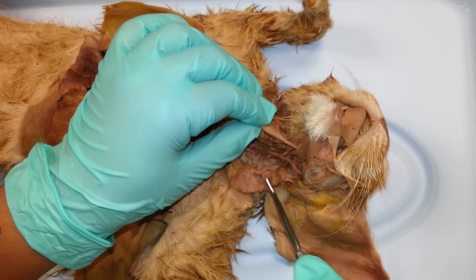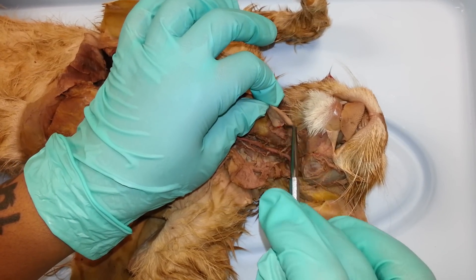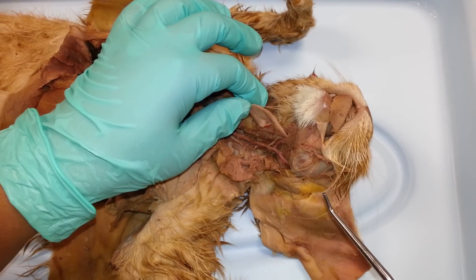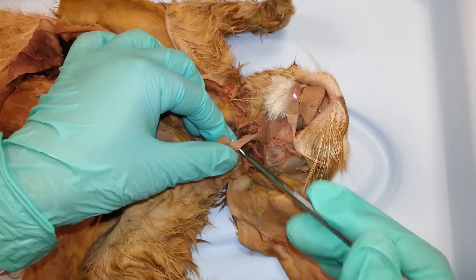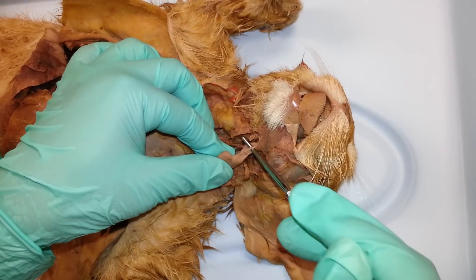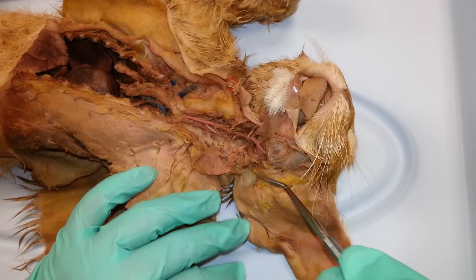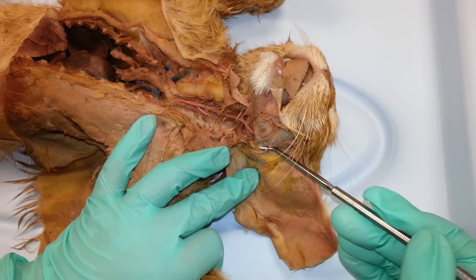Sublingual gland. Mandibular duct on the mandibular gland. Parotid duct off the parotid gland.